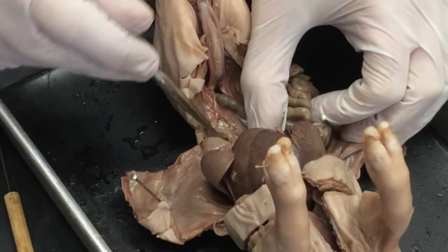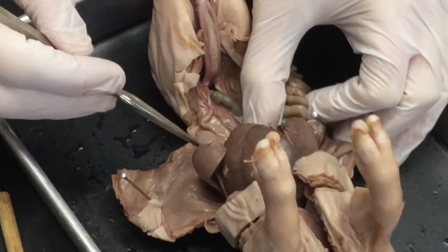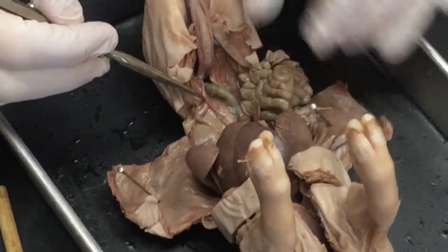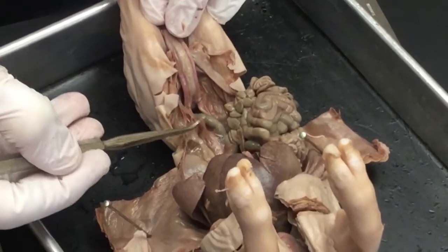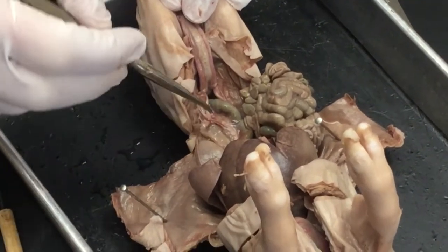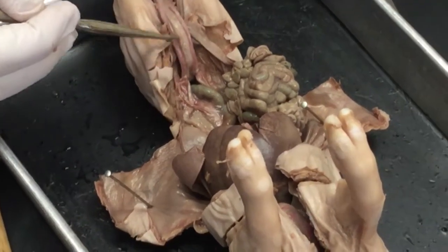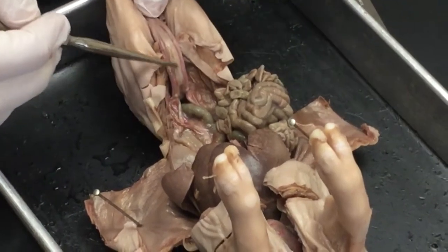And the ureter is this tubule here, and it's transporting urine from the kidney, so the kidney is responsible for producing that, transports the urine down to the urinary bladder. So if we continue to follow that down, I can see a couple of arteries there, but if I continue to follow that down, it's going to lead to the bladder. So remember, this is my urinary bladder, and I'm also going to have a second ureter on the other side.